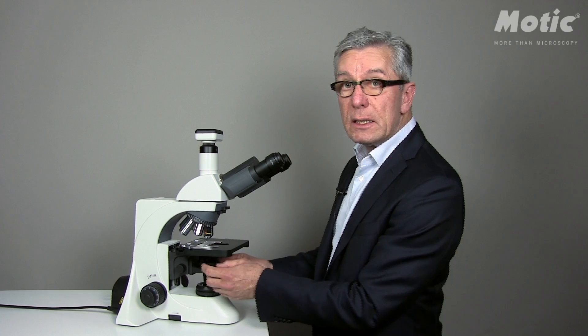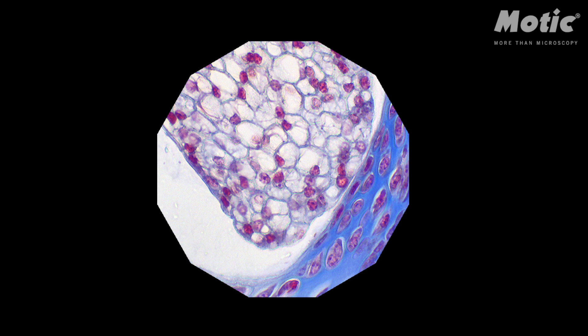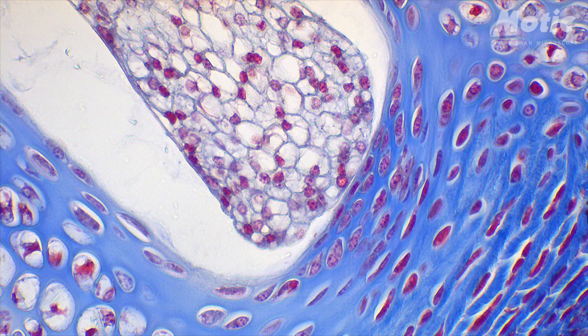If the spot of light is not concentrated in the middle, you have to move the diagonal screws on the condenser carrier until the spot is moved to the middle of the field of view. Then open the field diaphragm up to the point where it is not visible at all.